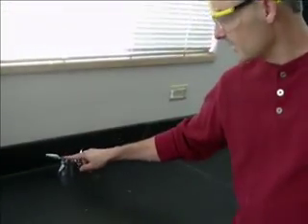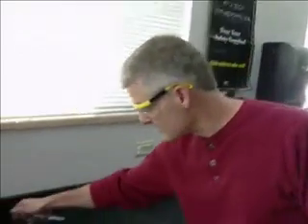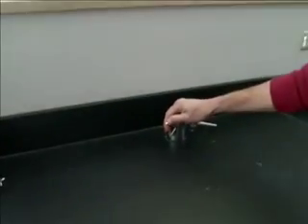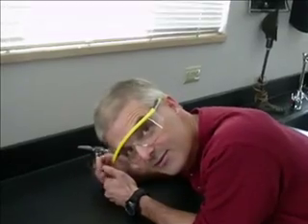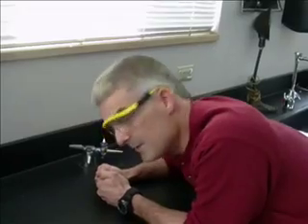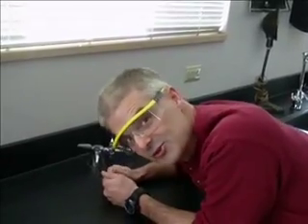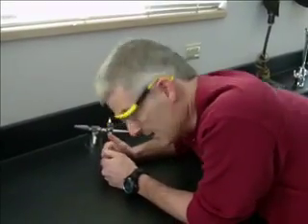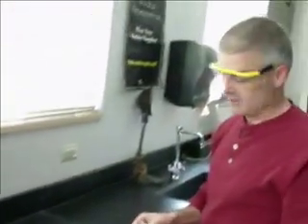I happen to have a gas jet right here, and this has natural gas or methane gas coming out of it. I can turn the gas, and you can hear it hissing. What the student did is he had a lighter, and he said, Mr. Bergman, what would happen if I did this? He had his face right in front of the gas jet with his lighter. I'm not going to put my face in front of it as that student did. Luckily, I screamed loud enough. So we're going to do this on a much safer basis.